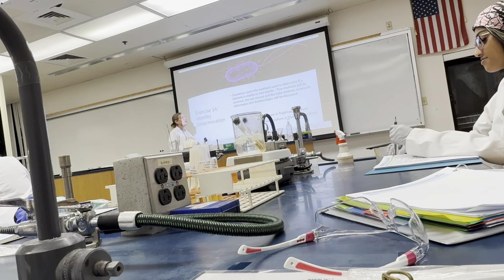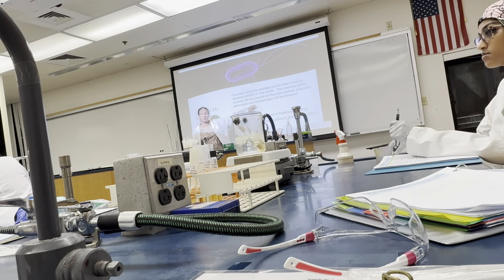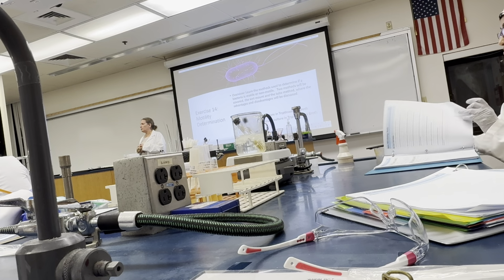The other method is the tube method, where we're going to inoculate motility test media. Everyone is going to inoculate a motility test medium. You are going to do one of the 2 organisms, and your lab partner the other. For those tables where you don't have a lab partner because you're a group of 3, that's fine. The other person, just pick one. I don't care which one. It's more to practice the technique, okay? And you'll share and get the information from the other people at the table.